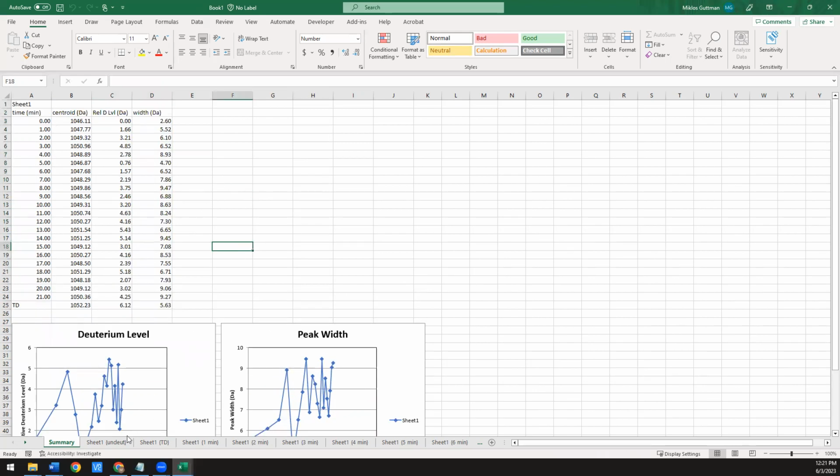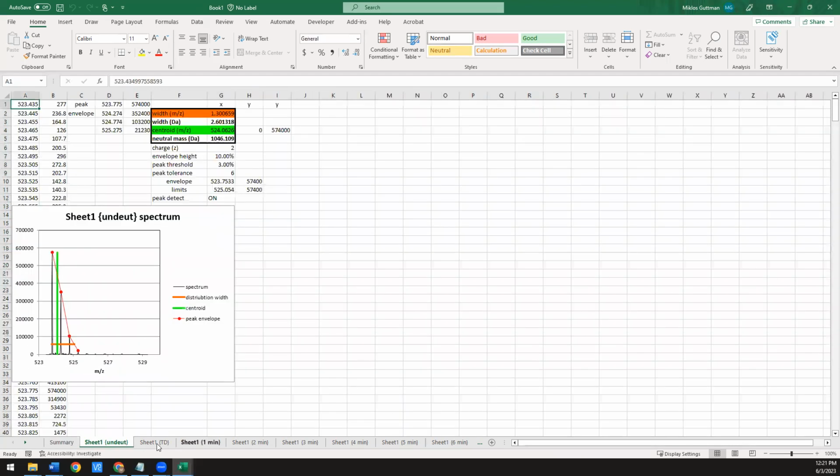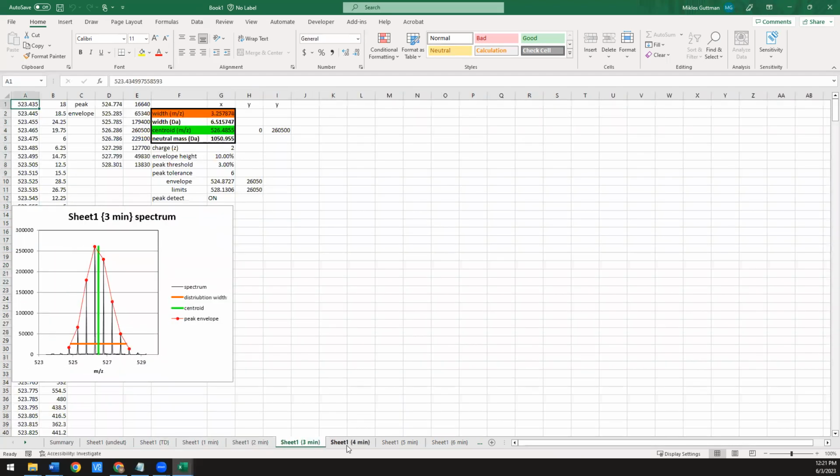So after this step, what we now want to do is look at our data and see, okay, does anything look weird? And of course, we're going to be talking about bimodals today. So here's an example of a clear bimodal. This is actually synthetic in that I had a peptide in either an undeuterated state or in a fully deuterated state. I mixed them 50-50 and I ran it. So that's why you see these nice, well-resolved two populations.